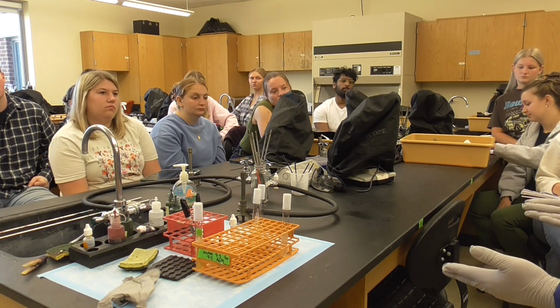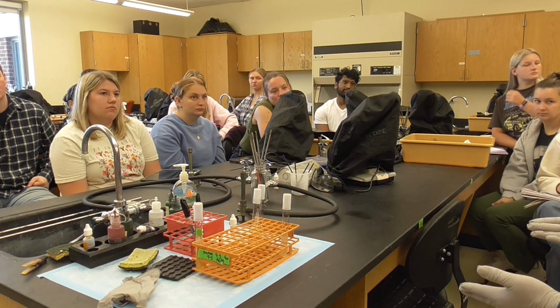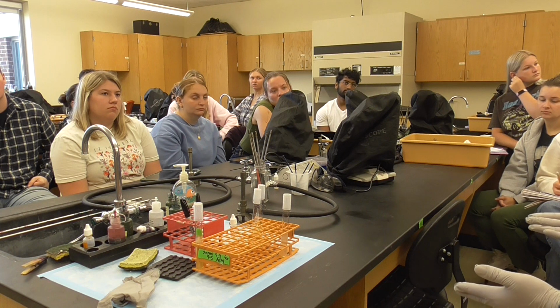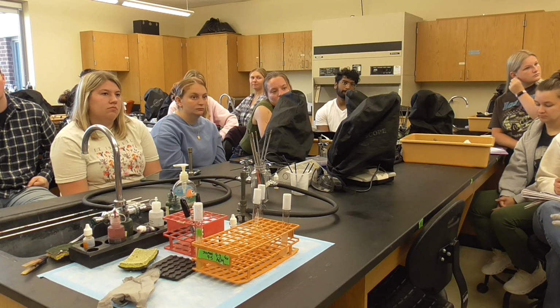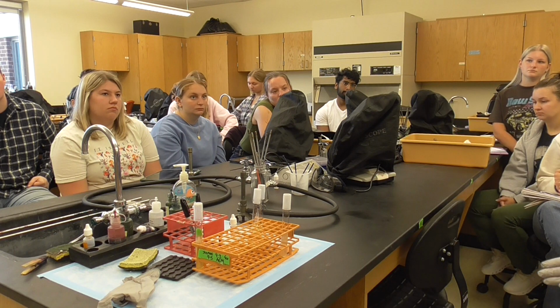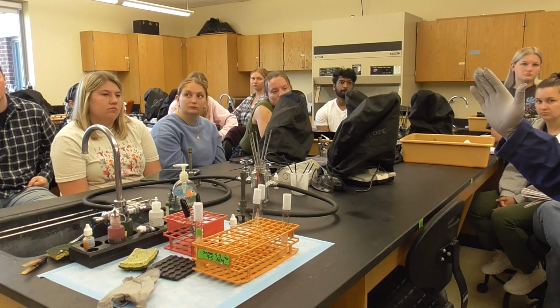Because later on, especially when we move on to biochemistry tests, you may have 5 tubes in one lab or 7 tubes in one lab. If you do not do a good job of labeling, not organized, you're going to spend 20 minutes to find your plates or the tubes in the next lab. That happens all the time.